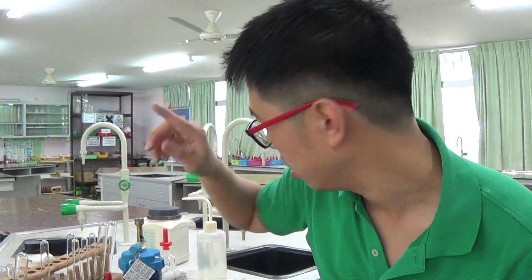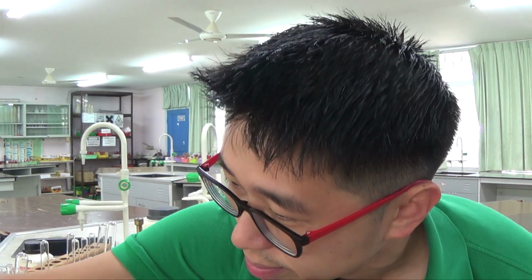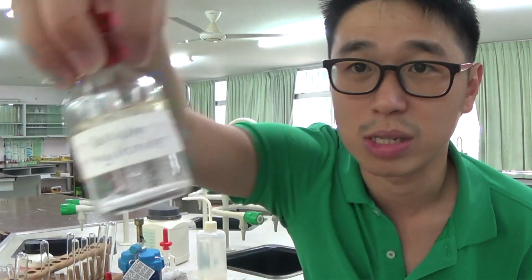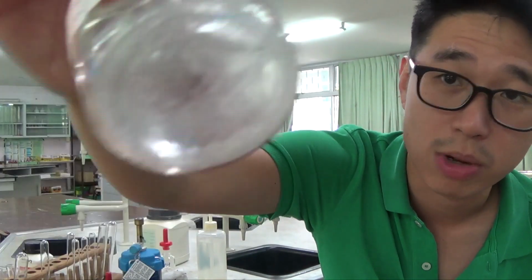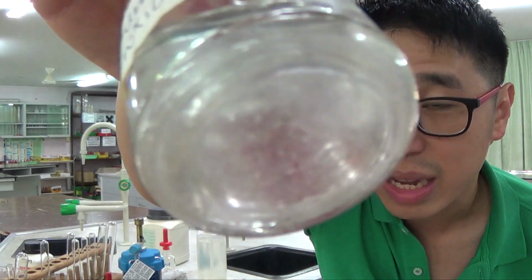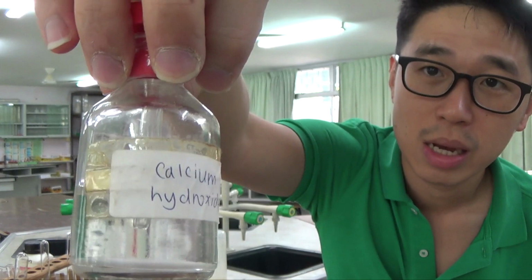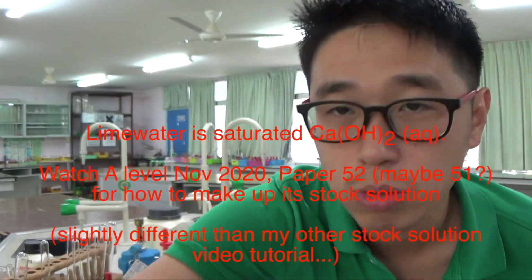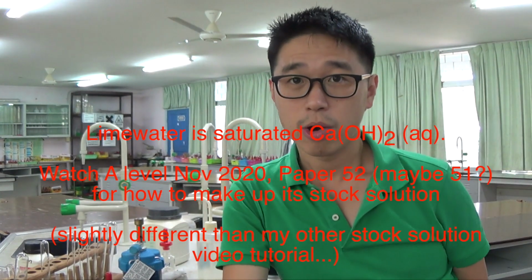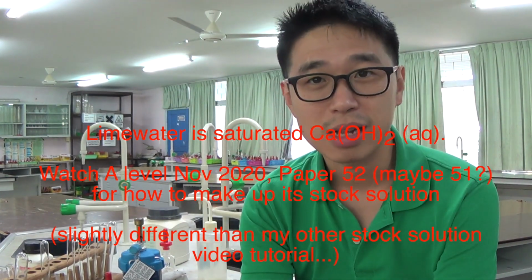Lime water is actually calcium hydroxide. As you could see at the bottom there, there's a bit of white precipitate already, because lime water is actually saturated calcium hydroxide, Ca2+ and OH-, Ca(OH)2.